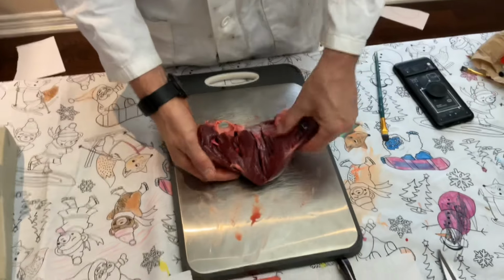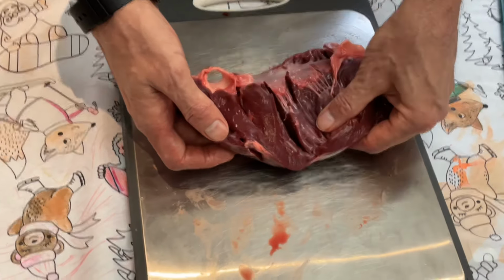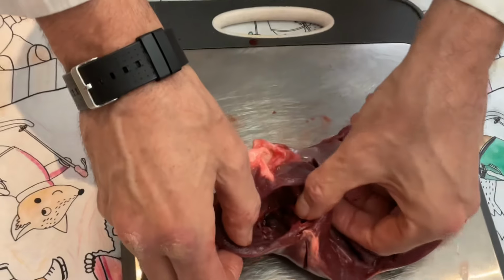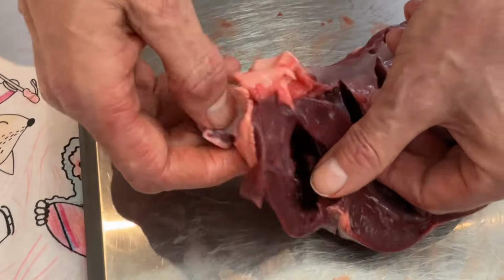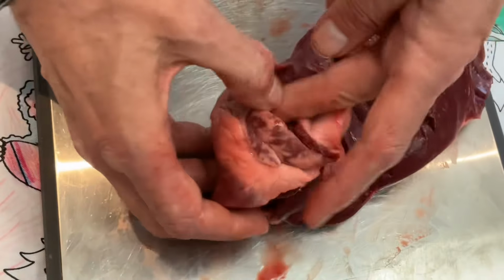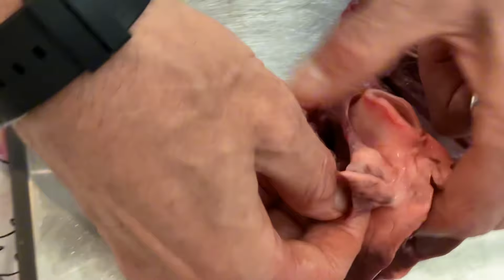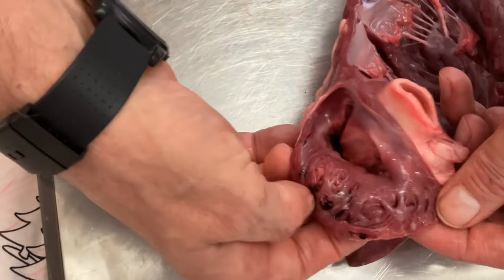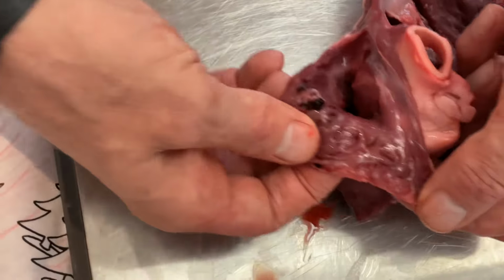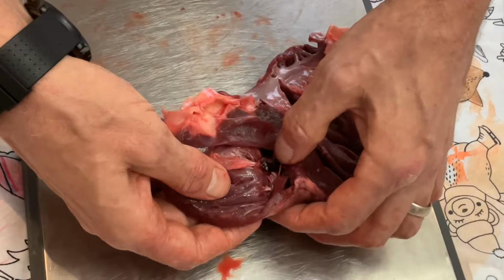Now, this is all the muscle on the left side. You can see that the left ventricle is significantly thicker than the right ventricle. There's the right ventricle. You're looking inside the right ventricle. The right atrium was kind of wrecked a little bit, but there's a bit of it up here. Okay, this is the right atrium. It was cut right open, but you can see the detail of the muscle in the wall of the atrium, whereas the muscle in the wall of the ventricle is way thicker.